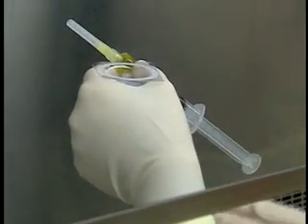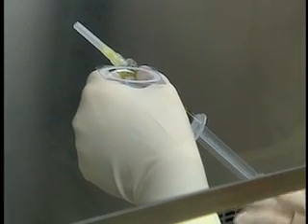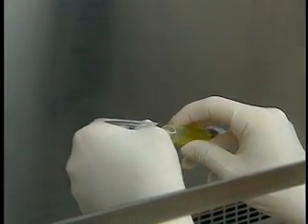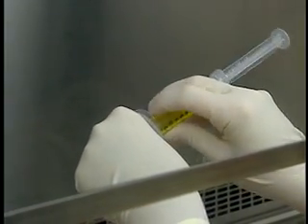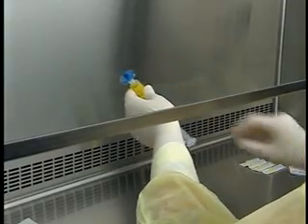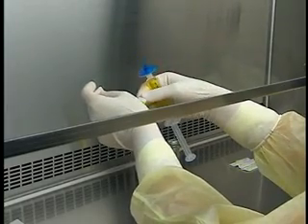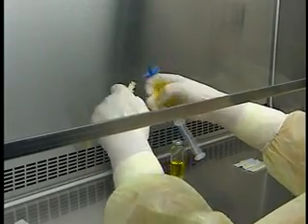Pull back the plunger of the syringe to empty the needle and then remove the needle. Attach the syringe to the filter and take the filter out of its wrapping. Make sure that the unwrapped filter is exposed to the laminar airflow. Attach a new needle to the filter keeping the assembly at a 70 degree angle.